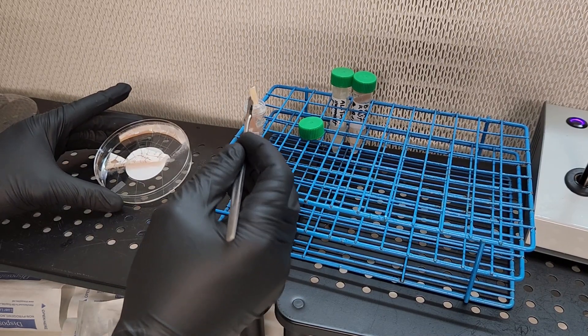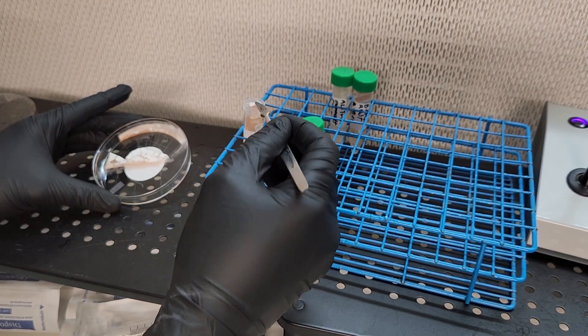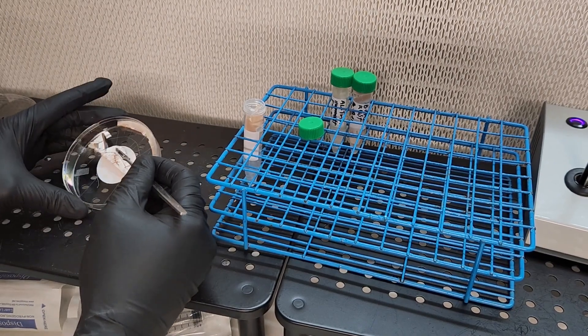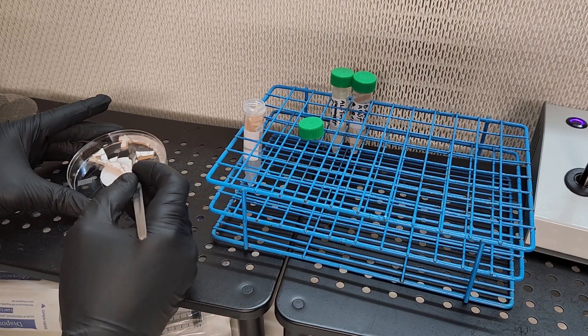What you want to do is ensure that there is very little oxygen at the top of the slant, and this will help to prevent anything from going bad. Don't worry about the transfers getting a little bit jammed up together when you're putting them in there.